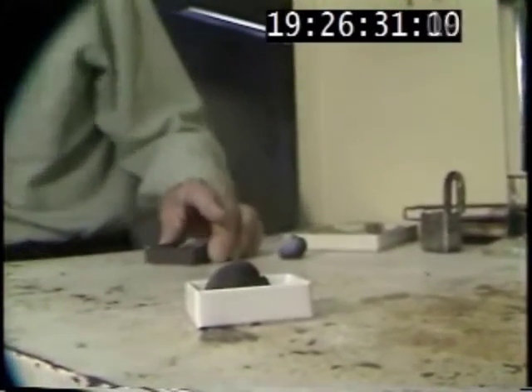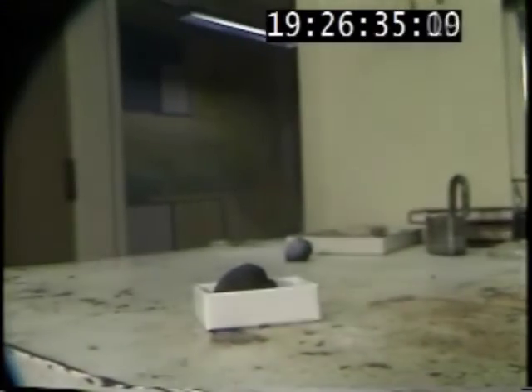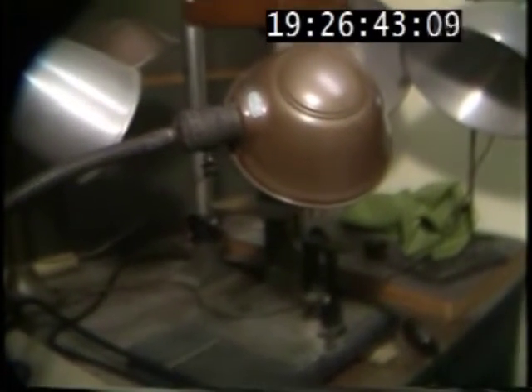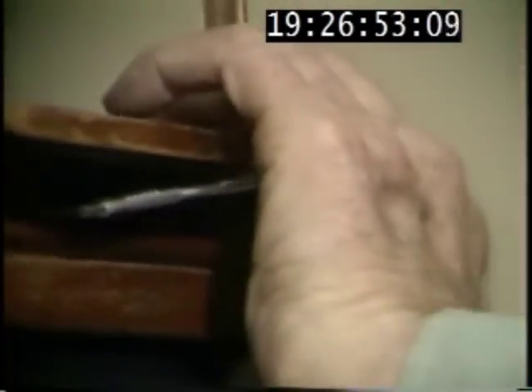Then the specimen goes over here. You'll see the very beautiful camera apparatus. This looks new. In order to take an X1 with a particular lens, all I have to do is — this bar is calibrated for a 120mm lens that's put under here.